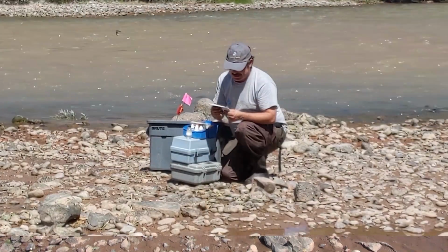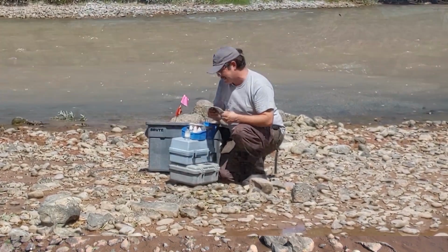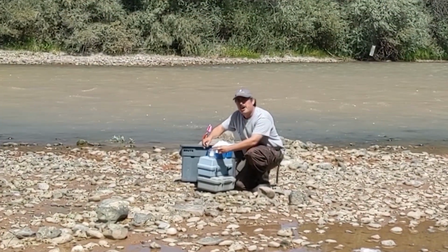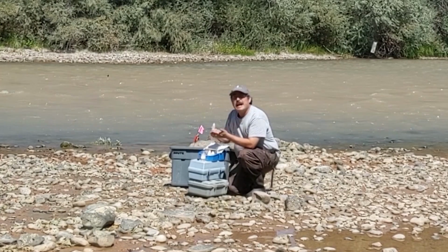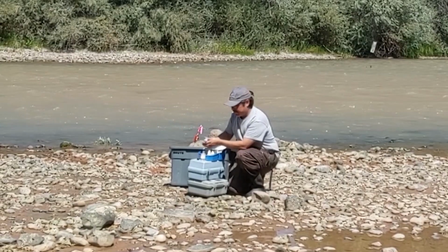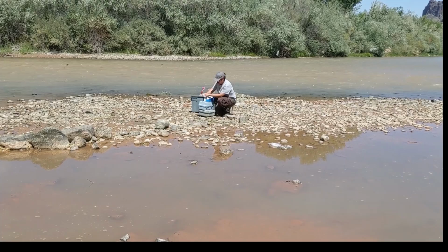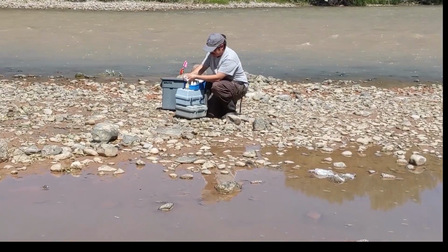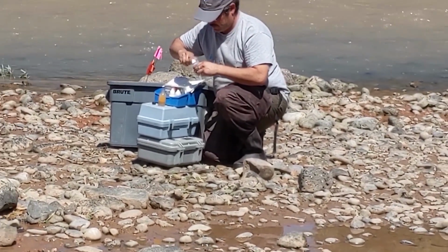The next part of the test says to add 8 drops of alkali potassium iodide azide. You notice when I'm adding these drops, I'm holding the dropper a little bit above the bottle so that I can keep track or even count how many drops I put in there. I didn't do it last time, but this time I'll count them for you so that you can see that I'm keeping track. 1, 2, 3, 4, 5, 6, 7, 8, and we are good to go.